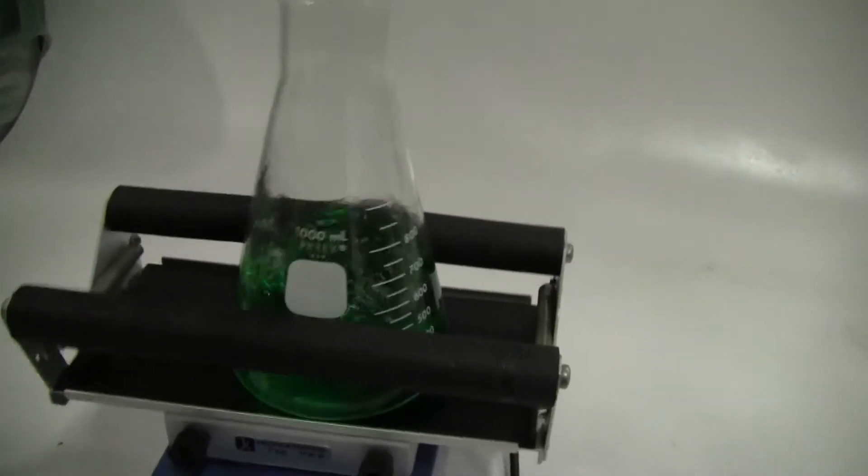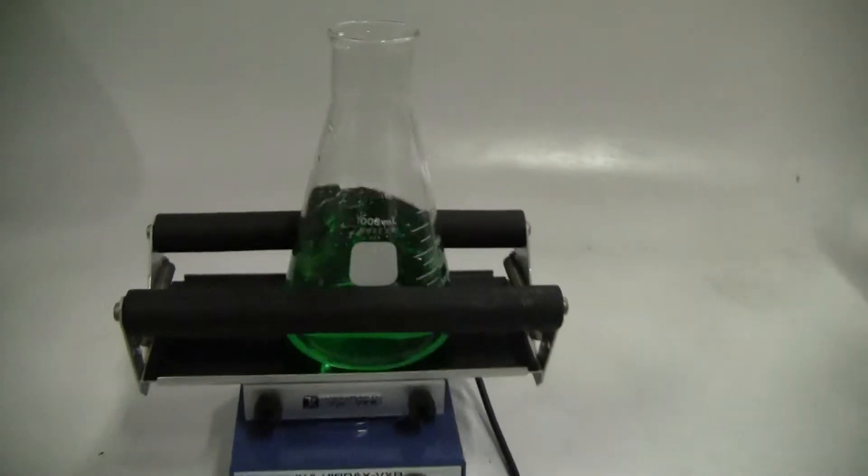If I do it a little bit higher, I'll start losing my liquid. If I put it at a low speed, it gives a nice little shake.